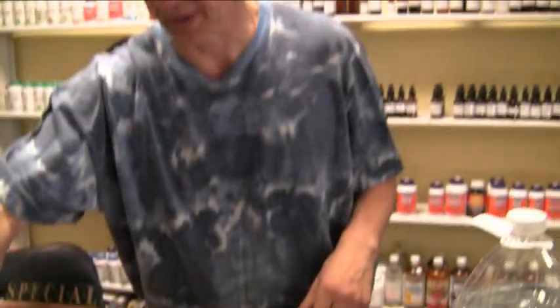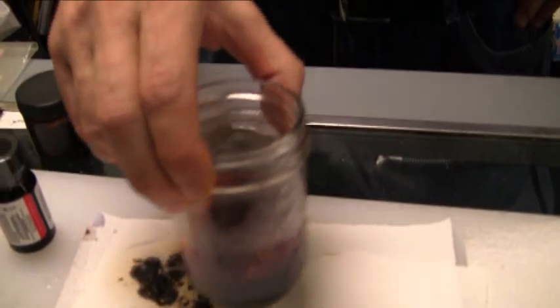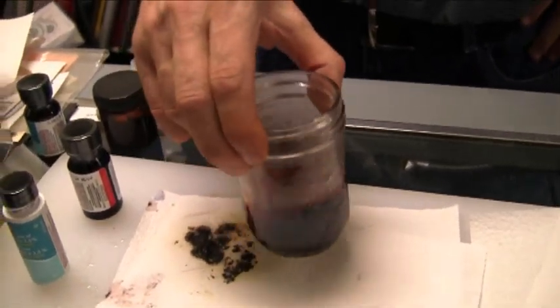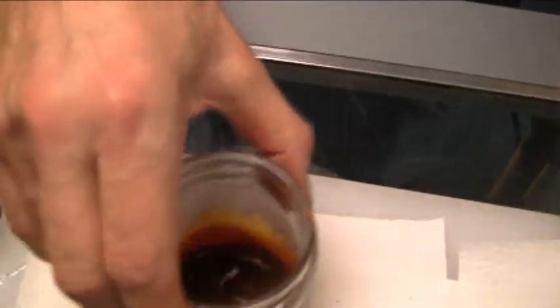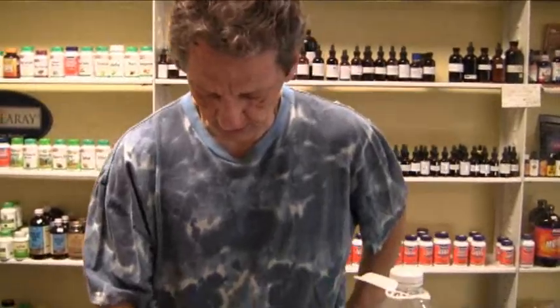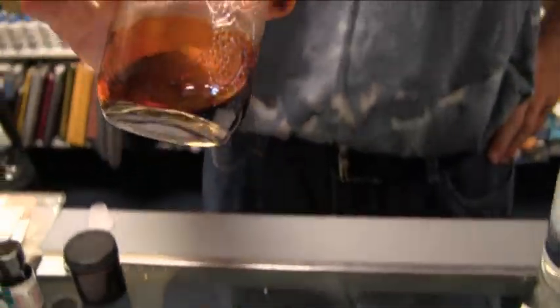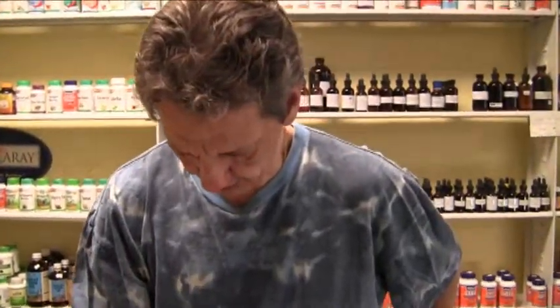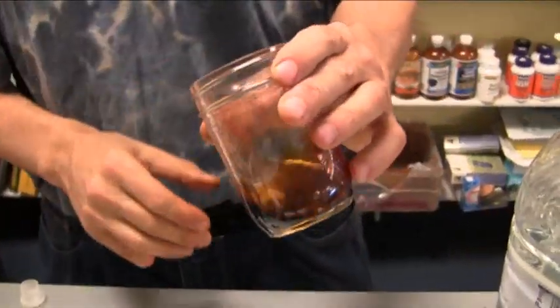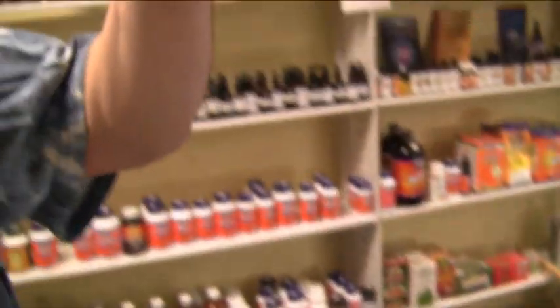As you can see, she's already started. Now we just swirl it. Can you hear it? It's reacting. It's not crystallizing yet — it should crystallize. Hmm, why didn't that work? I might have put too much water in. It's starting to crystallize now — you're starting to see some crystal forming there. It takes a moment for it to work. Keep swirling it, and as you keep tipping it you'll start seeing crystals starting to form.